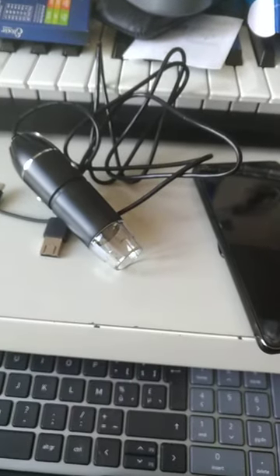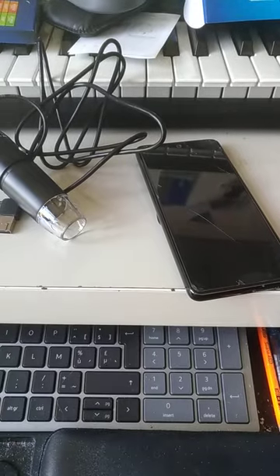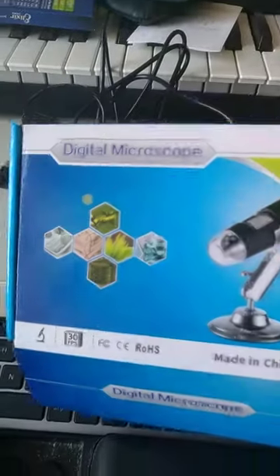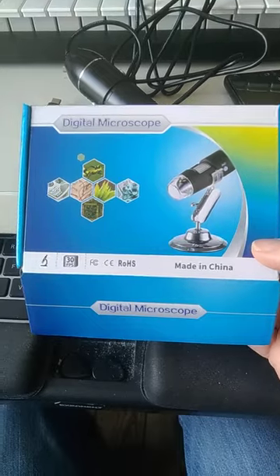Okay, so I'll try to. It's going to be a little tricky for me to shoot this with one hand, so I'll have to put the phone down from time to time. But so this is the microscope I got from you, TomTop.